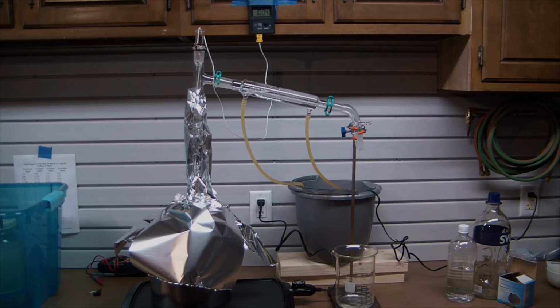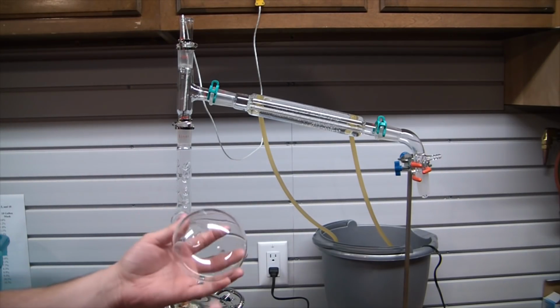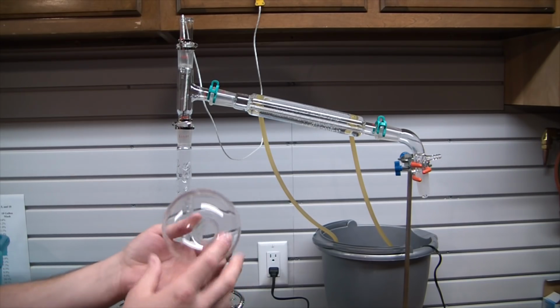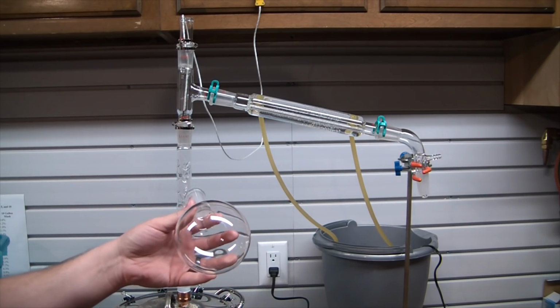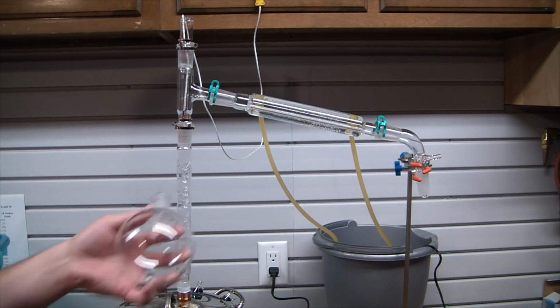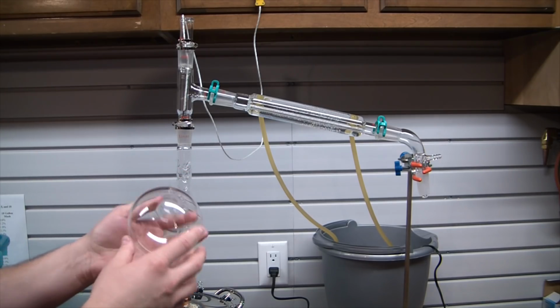Have a good one. So just a quick note about this Chinese glassware. In this instance, I was sent what I believe is pretty reasonable quality glassware. It seemed to withstand thermal shock. I did run it through a few tests, threw the oven up at 400 and just tossed some glassware in. No fractures, nothing of that nature occurred.